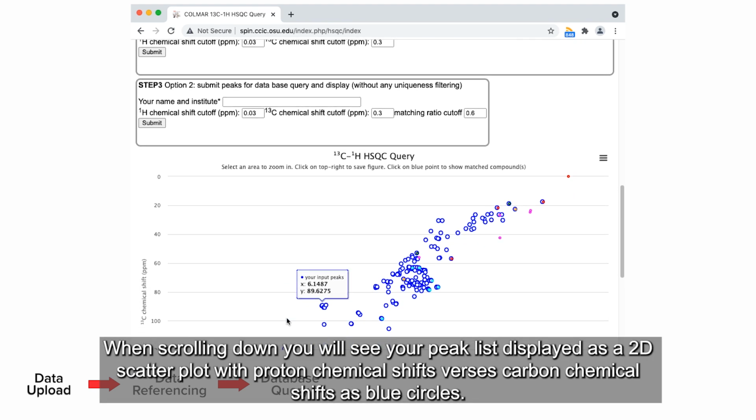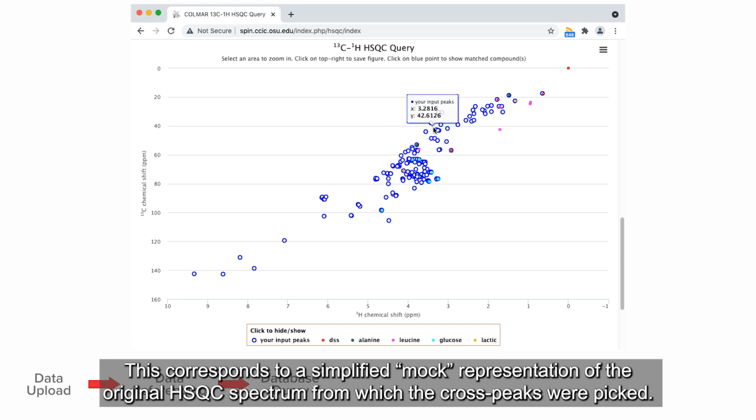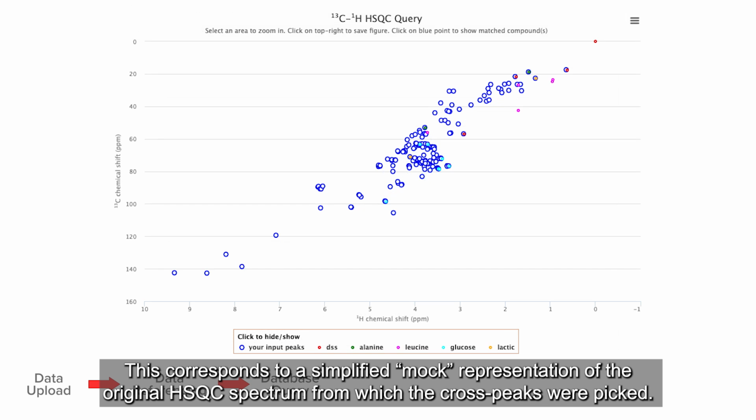When scrolling down, you will see your peak list displayed as a 2D scatter plot with proton chemical shifts versus carbon chemical shifts as blue circles. This corresponds to a simplified mock representation of the original HSQC spectrum from which the cross peaks were picked.